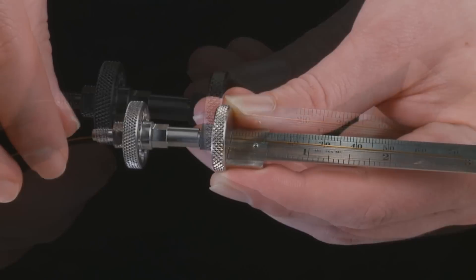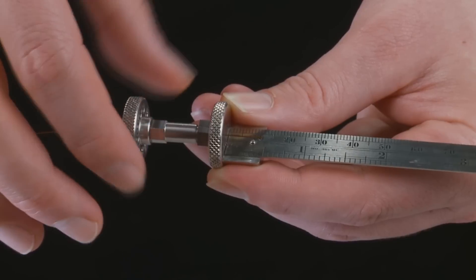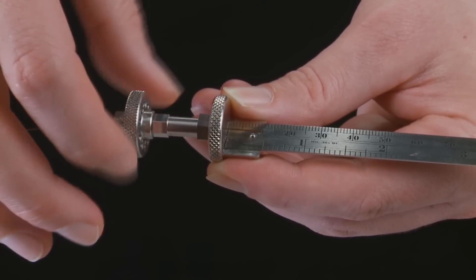Adjust the length of the column to the desired length required by your instrument manufacturer. Further tighten the cool lock nut into the gauge until the column cannot slide.